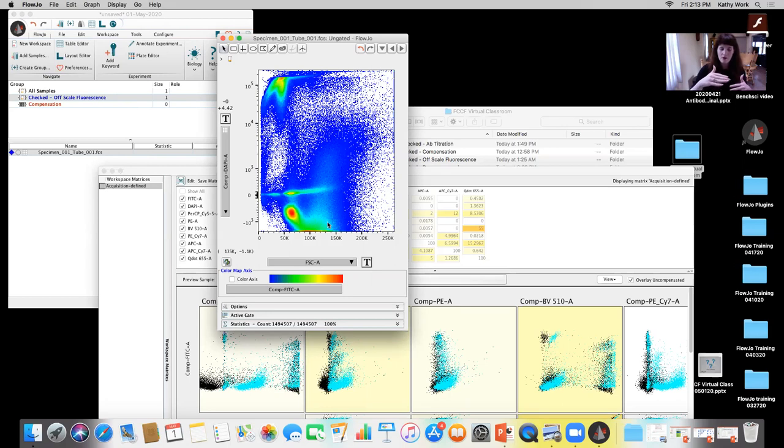So the main issue is that you have overcompensation, and that shows up as extreme negative in other detectors, right? The other thing that can occur, which isn't the case for this experiment, is that you can wind up not washing sufficiently. As a result, the background fluorochromes, or antibody fluorochrome conjugates, that are in your sample will cause certain instruments to have an excess in the subtraction of the baseline signal, and it's called baseline restore. When that happens, you can also have extreme negatives that are more dramatic than what you'd expect from your normal autofluorescent population.